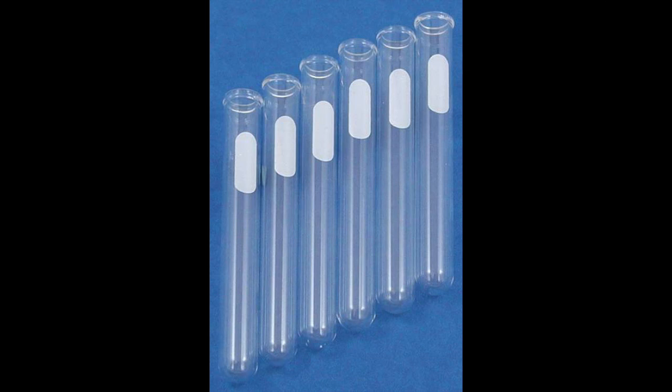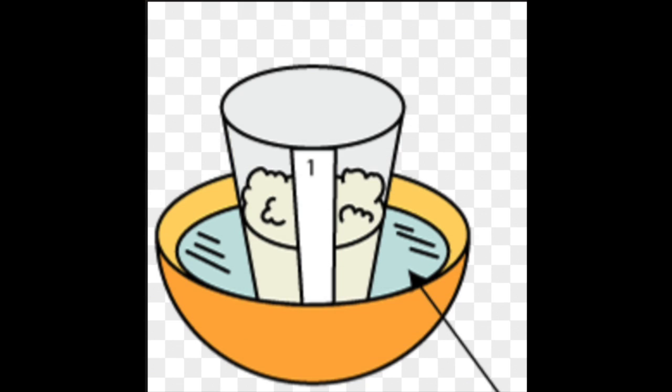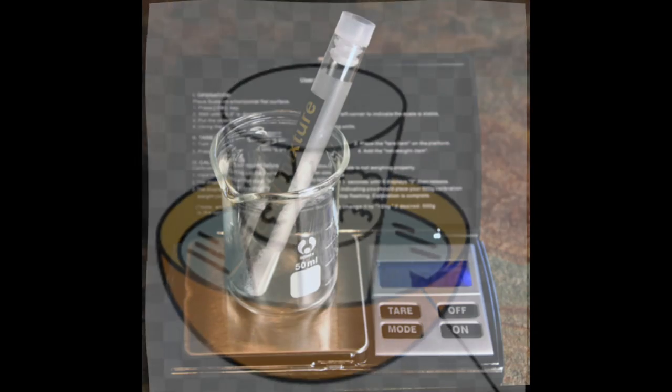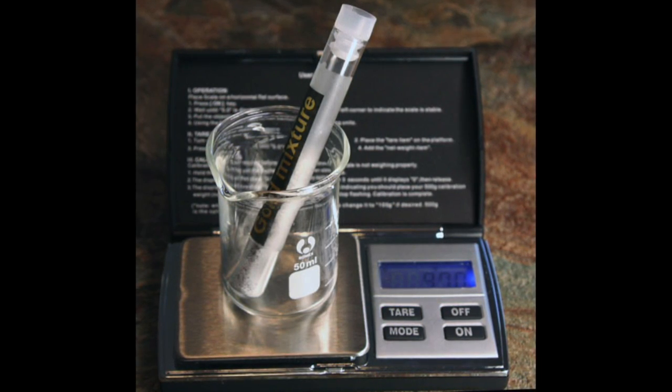We poured the water, sugar, and yeast into tubes and mixed the ingredients together. We weighed an empty tube and a filled tube so we could find the weight of the ingredients alone. The filled tubes were then placed into a beaker of warm water and allowed to ferment for 10 minutes. We weighed the filled tubes again and subtracted the weight of the tube and the original filling.